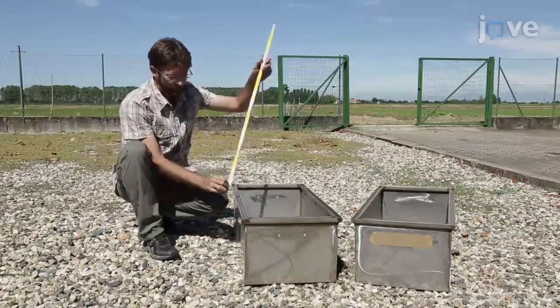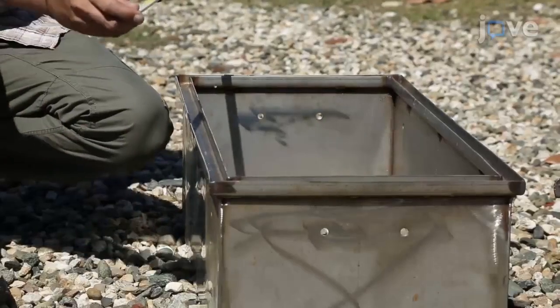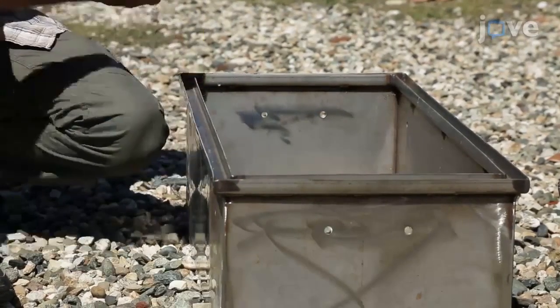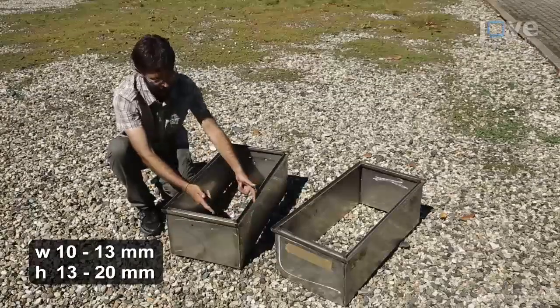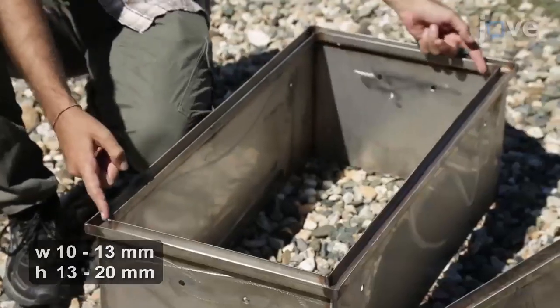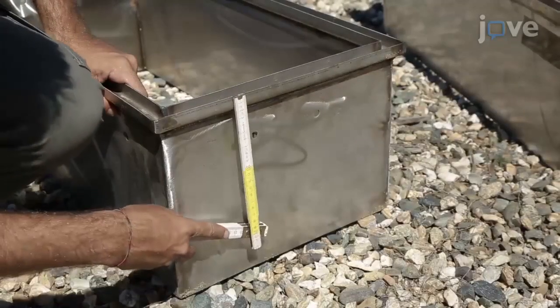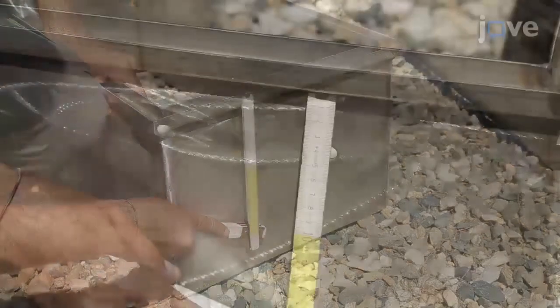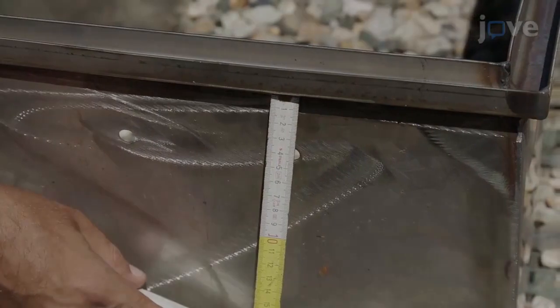The anchor is a 75 cm x 36 cm x 25 cm rectangular box made of stainless steel. A water-fillable channel is welded to the upper rectangular perimeter of the anchor. Two holes on each of the four sides of the anchor, 5 cm from the upper water channel, ensure fast discharge of ponding water within the chamber during field drainage events.